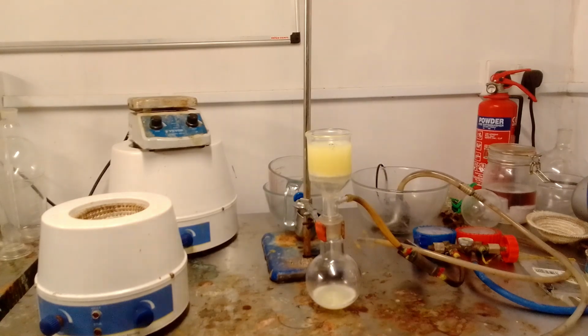As a result, the pump was pulling a pretty tight vacuum, and when I switched the pump off and didn't disconnect it from the filter quickly enough, some suckback occurred and the filtrate became contaminated with a few mils of brown hydraulic oil. The nature of this procedure means that this unexpected addition was annoying but not disastrous.